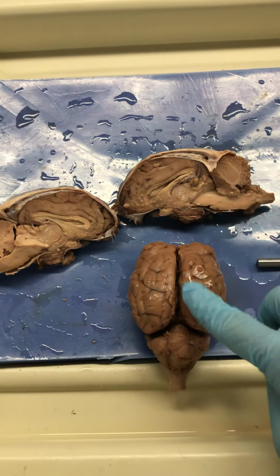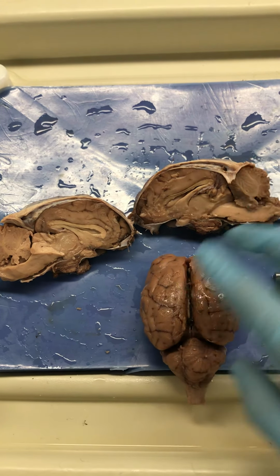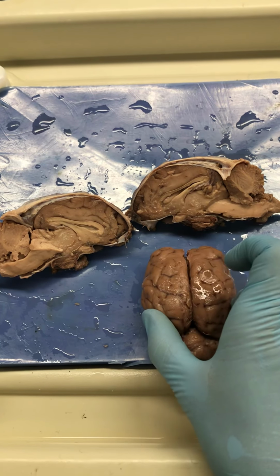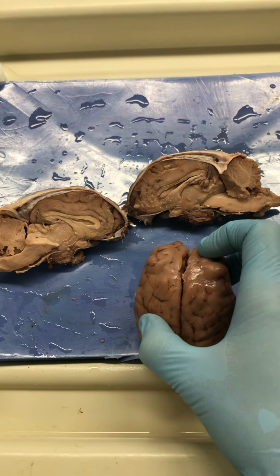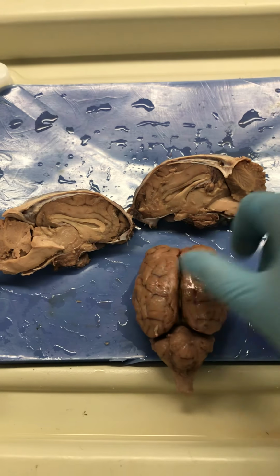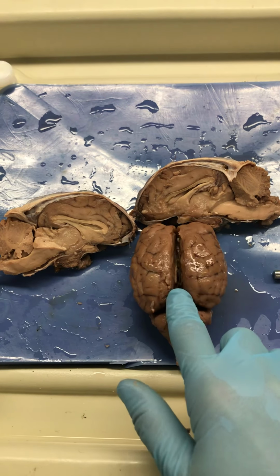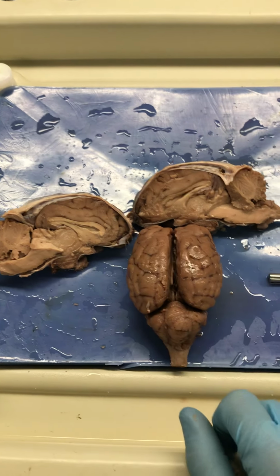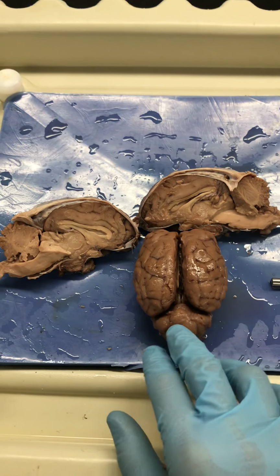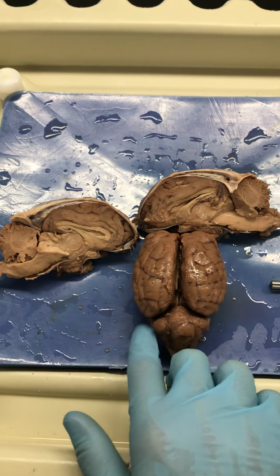It has 2 hemispheres, as you can see, the right hemisphere and the left hemisphere. And I've cut it by slicing down the longitudinal fissure here. I've cut through some of the thinner meninges. We've got 3 layers of meninges, not just the dura mater. So I've cut through those meninges and kind of pried the brain apart so you can see that longitudinal fissure that separates the 2 halves of the cerebrum. And then we have the cerebellum, the little brain, and this one is separated from the cerebrum by the transverse fissure.